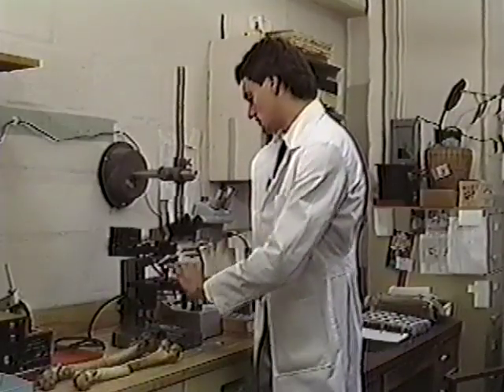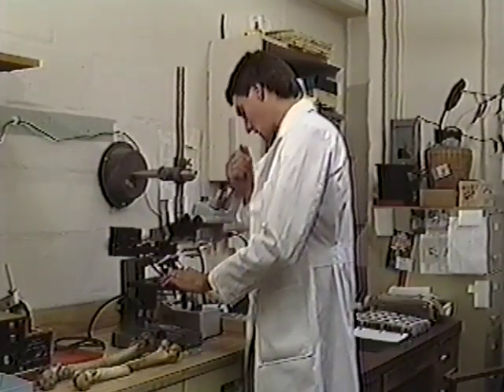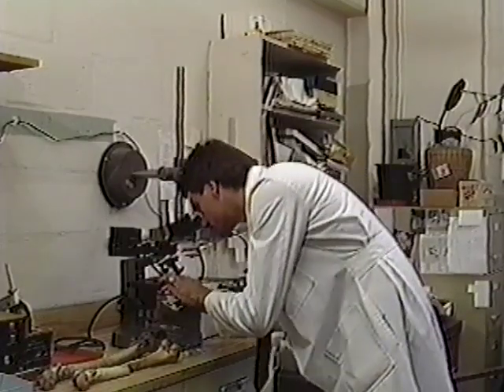If we remove this slide and stick a yet older individual in, this individual is in his mid-60s, and now you can see with ease that this individual is an older age individual because all you see in this field are osteones or osteone fragments. So this is a simple demonstration of how the bone histology changes with age.